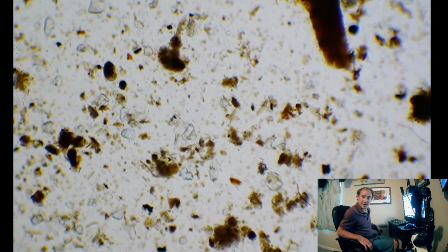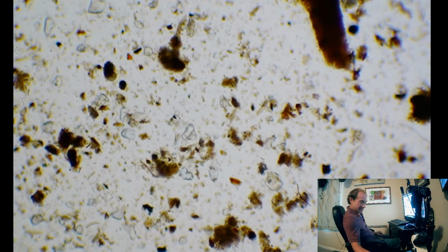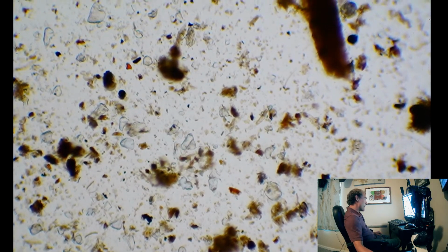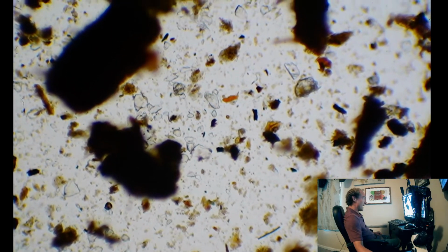Today, we're looking at my sorghum, or some soil, I should say, under my sorghum, that has developed a fungal pathogen. Anthracnose is, I believe, what it's called, unfortunately. So, we are going to look at the soil and see what may have caused this, or how we can improve it and essentially prevent it from happening in the future.